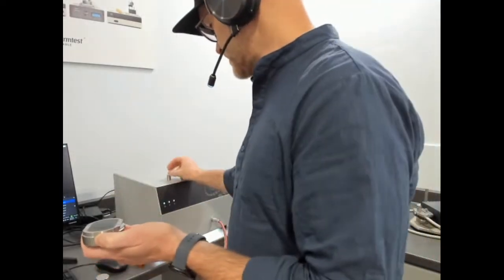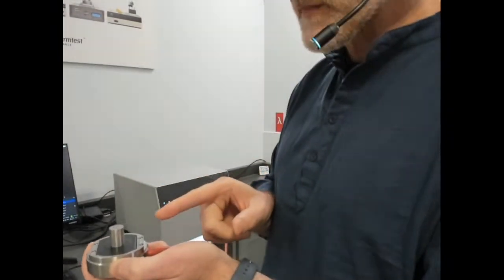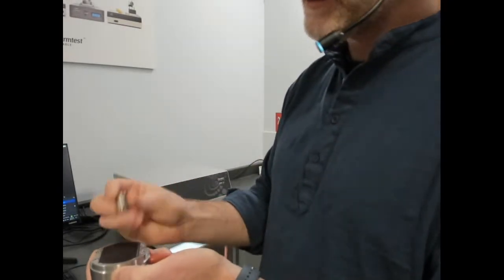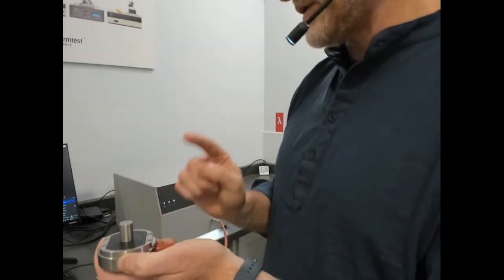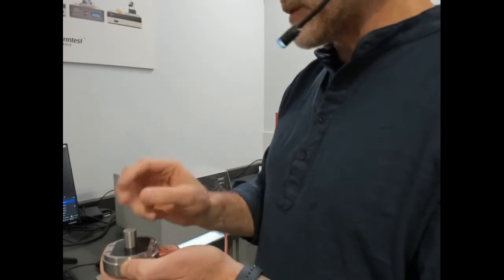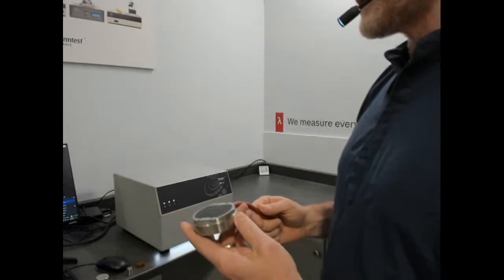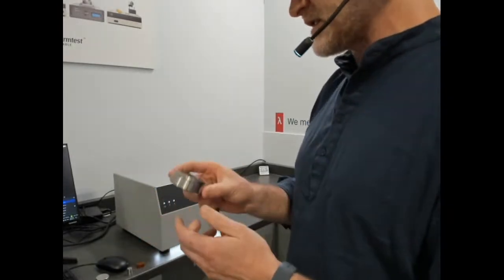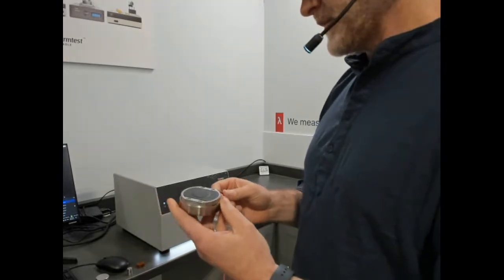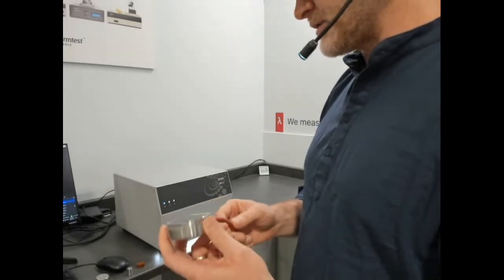And then we've measured our one-dimensional shape for thermal effusivity. With the input of specific heat, this is stainless steel 304, we should get the thermal conductivity, diffusivity, and of course the measured property, thermal effusivity. So that's a bit of a description. The point is there's a lot of interesting capabilities with this sensor and the release of the new ISO, and it's a tool set that you can use to basically measure a whole range of materials in unique ways.